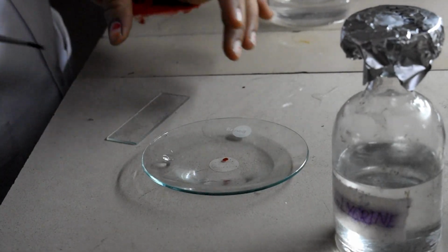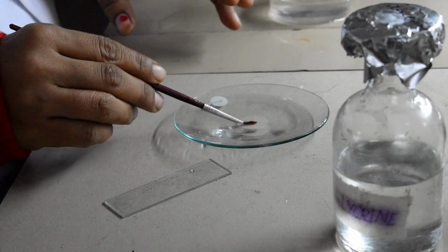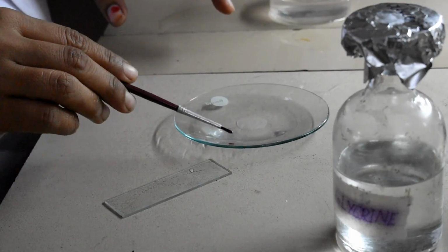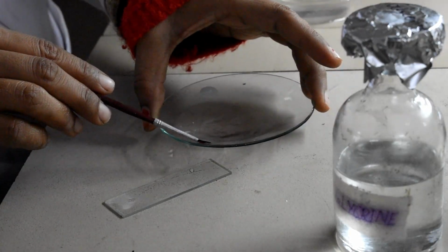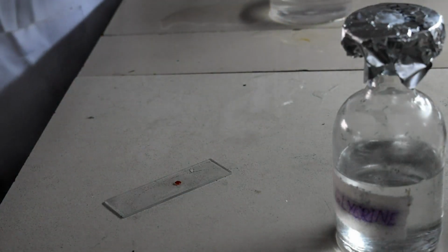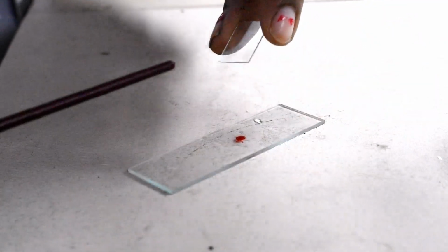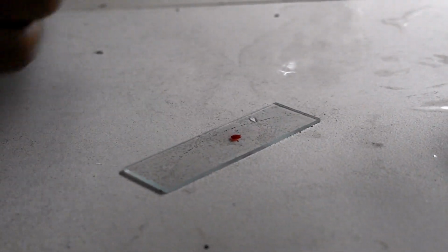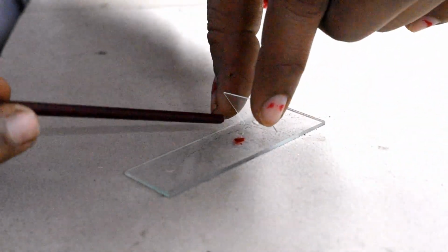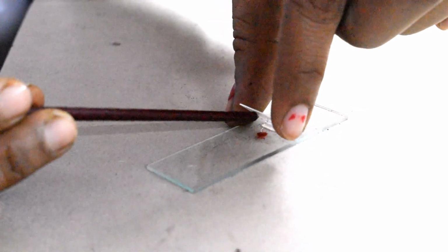First, how we are going to prepare the slide: we will keep this section which we have washed thrice with water, we will keep it like this and we will put 1 drop of glycerine here. You have to make the 45 degree angle first. Exactly you need a needle, but now you can do like that also.